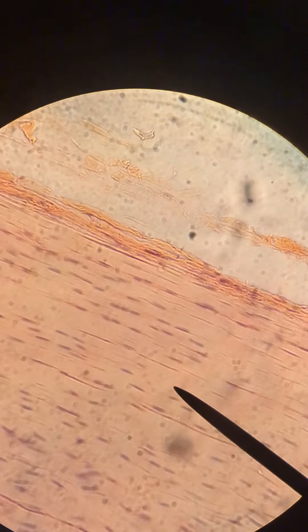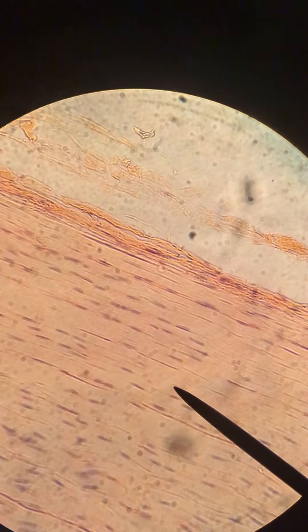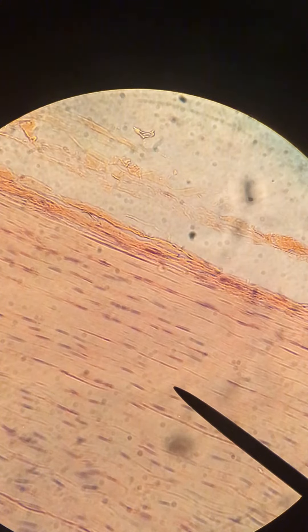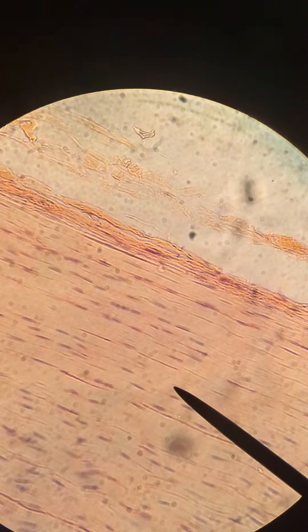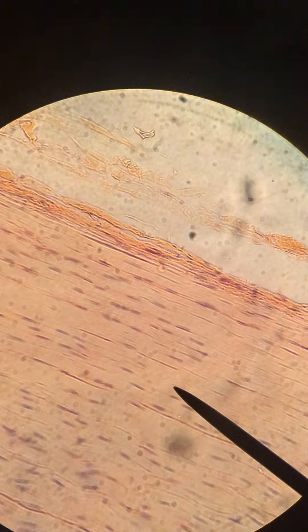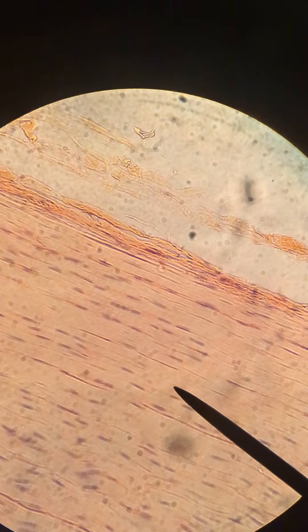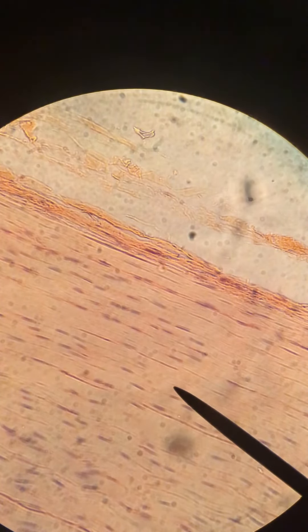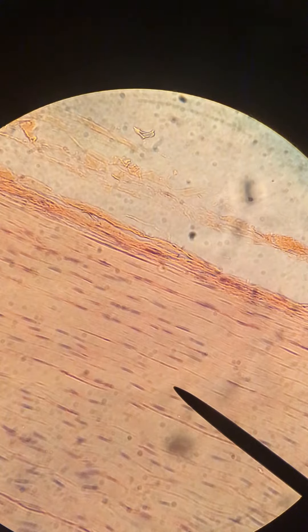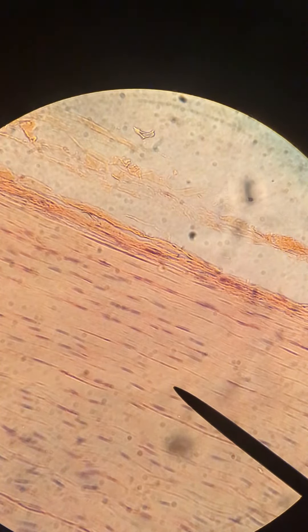The pink fibers that you can see here are collagenous fibers. They are oriented in a nice even parallel fashion, which is characteristic of regular dense connective tissue, as opposed to our irregular dense connective tissue where you have that random arrangement of the collagenous fibers.